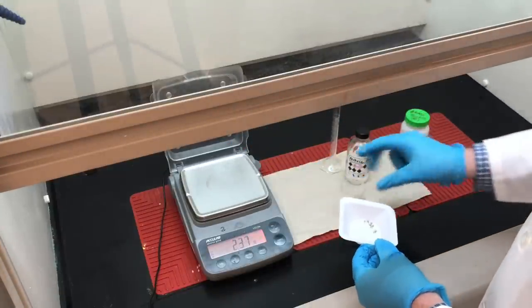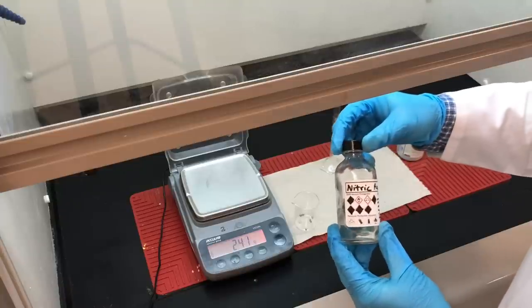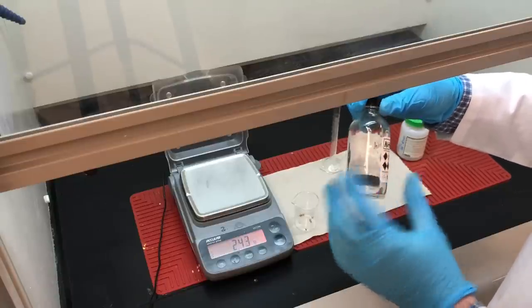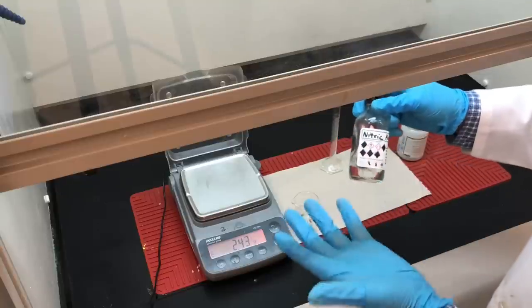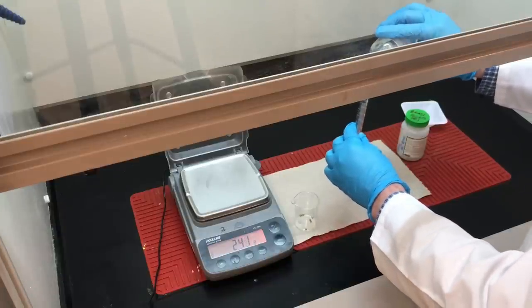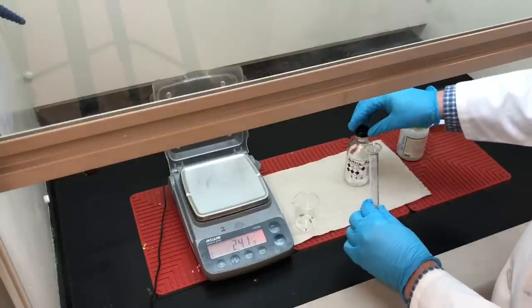I'm going to take those pellets and transfer them to a small 50 milliliter beaker, and then add some concentrated nitric acid. Nitric acid is highly corrosive, especially when concentrated. Concentrated acids are saturated — it's the highest possible concentration you can have. I've got a 10 milliliter graduated cylinder and I'm going to measure out approximately 4 to 5 milliliters of the nitric acid — it doesn't have to be exact.